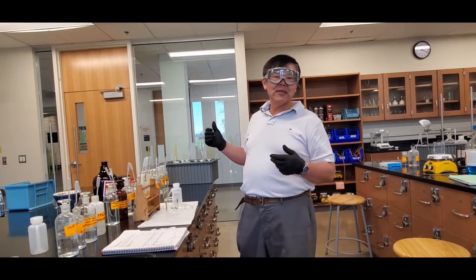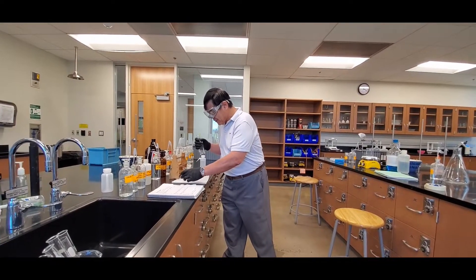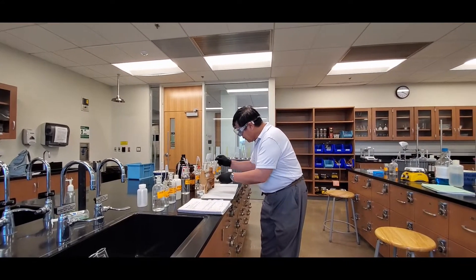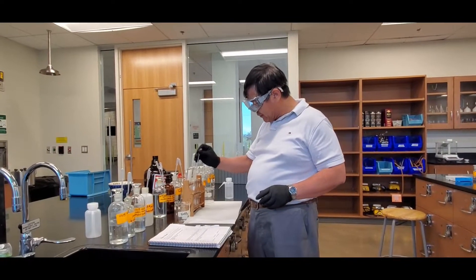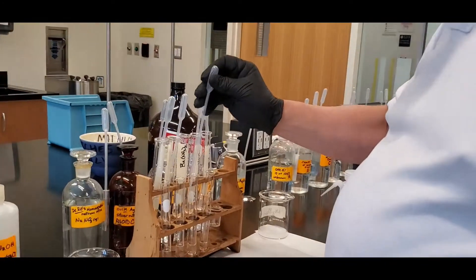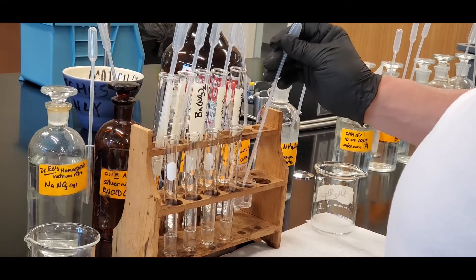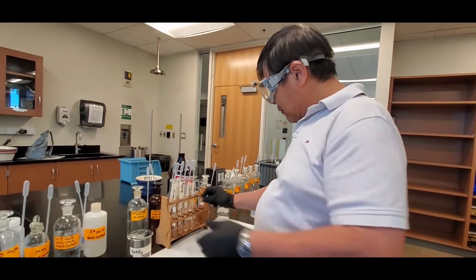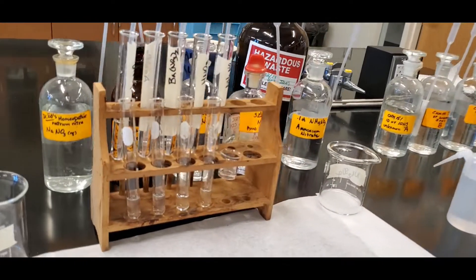Now that we've done sodium sulfate, let's do the sodium nitrate test. I have the four test tubes and the beaker loaded. Again, squirt from back to front. Adding sodium nitrate to: silver nitrate, barium nitrate, nitric acid, and ammonium nitrate. Sniff the beaker — nothing, no smell. It's that simple. Here are the observations — I'll zoom in and take a picture for you later.